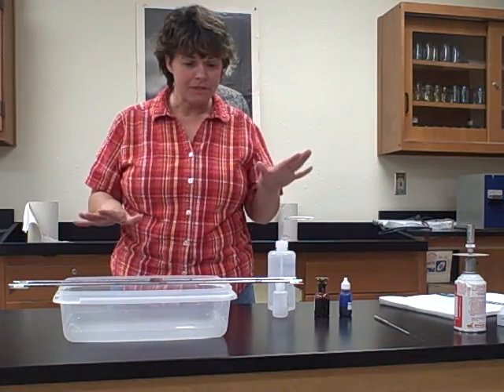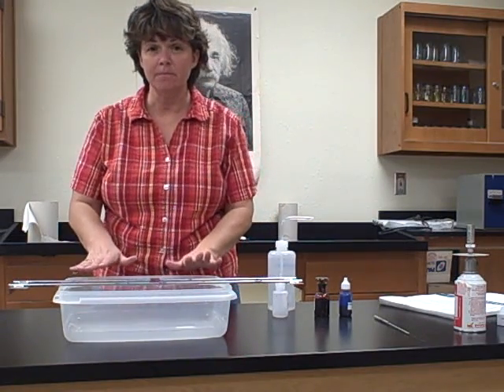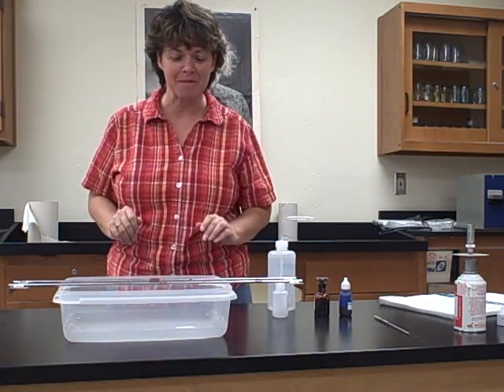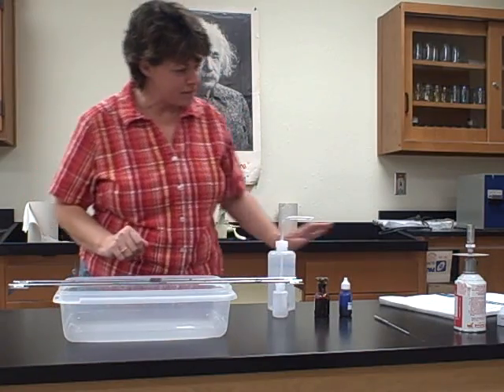Now, I have my supplies here, and I'm going to go ahead and do it on this tub so that you can see better rather than doing it on the sink. And I do have my friend here, Albert, to keep an eye on me, so I thought I'd keep him in the background.